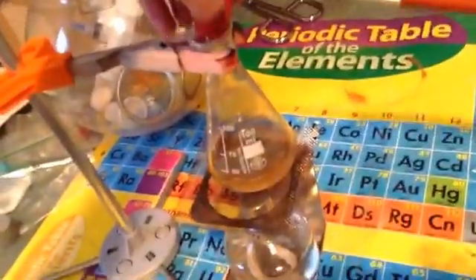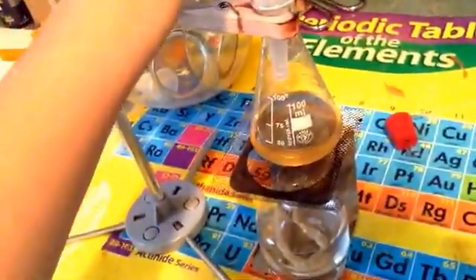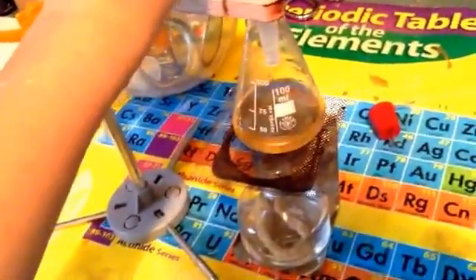It has to be cold. There we go. Let's get this off. Some stones for boiling. Just pour those in. And my funnel's not good enough. Just put some in.